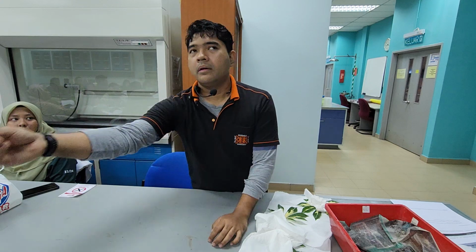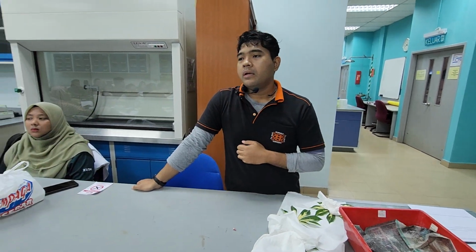Patutnya I do not detach first. I just want to see whether it can capture. Can it? Okay, it can capture. Right.